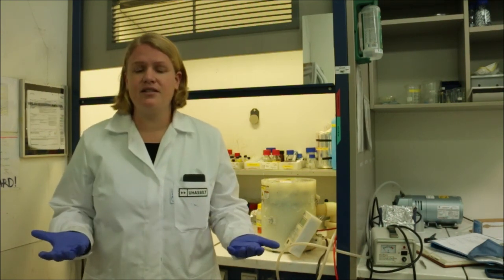To conclude, spin coating is a widely spread and very fast lab-scale deposition technique that is capable of coating very thin homogeneous layers. But unfortunately, it's not suited for continuous manufacturing. Only 10% of the spin-coated solution forms the actual layer, which means the other 90% is waste.